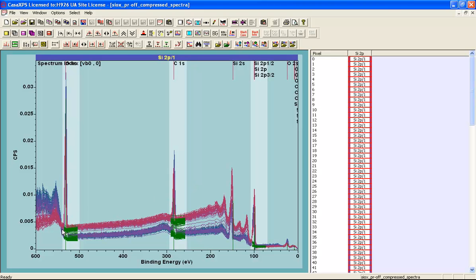So if we create spectra at pixels from these data and then apply regions to each one of these peaks of interest, so we've got an oxygen, carbon, and silicon 2p, we can extract atomic concentration images, so we know the intensity as a function of position for the oxygen, carbon, and silicon. And we can also extract information about the position of the peak in binding energy sense. So the binding energy of each one of these peaks may vary as a function of position. And that's the type of information that we need to understand the consequences of charge compensation.